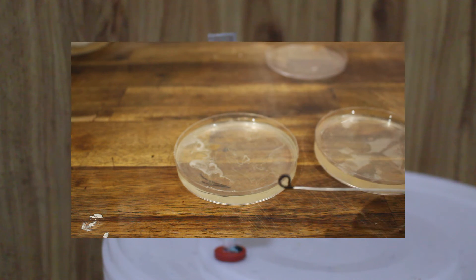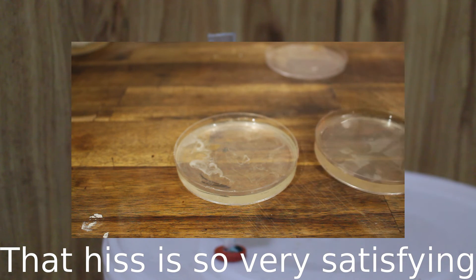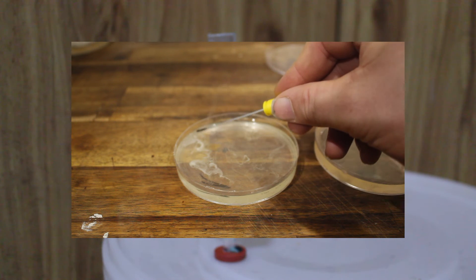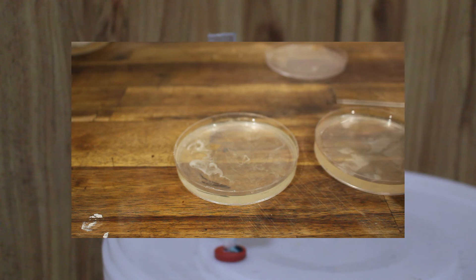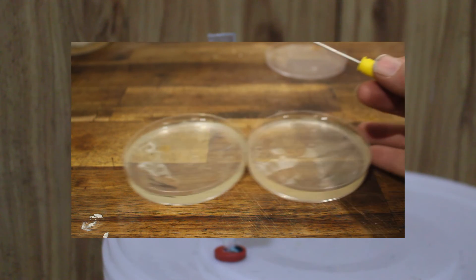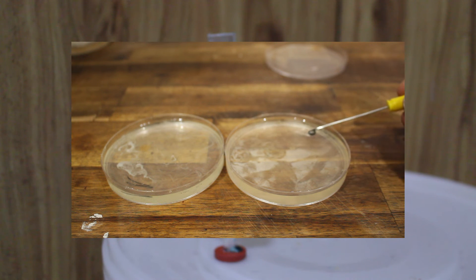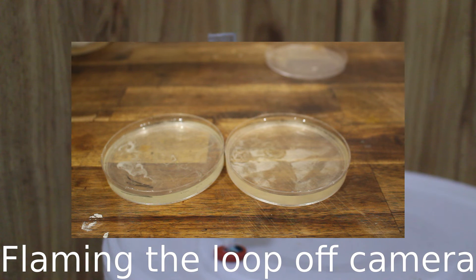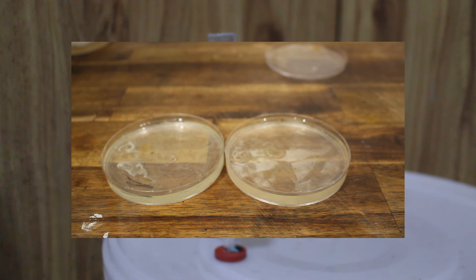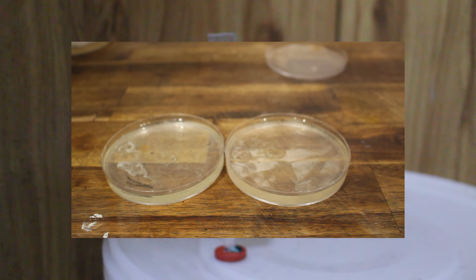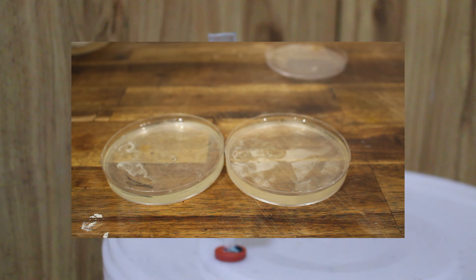This is done in a relatively straightforward manner. First, you find an isolated colony or take a sample of the plate in a loop or similar tool. Make sure to either wash this in alcohol or flame it first to prevent contamination. Now smear the loop with your inoculum over the plate, across from one edge to the other. Now change the direction by 90 degrees. Smear to the edge this way, repeat again, and then again. This will lead to very spread out yeast colonies, arguably with increasing space between them.